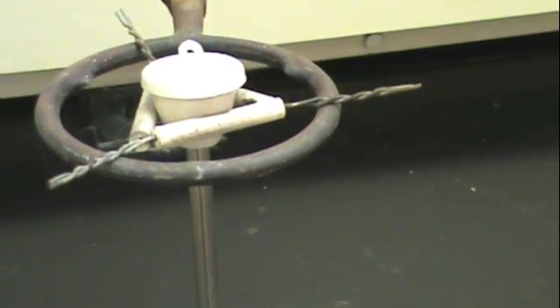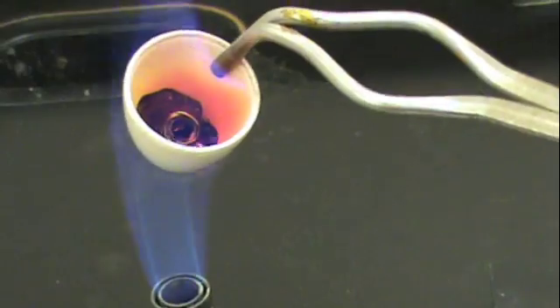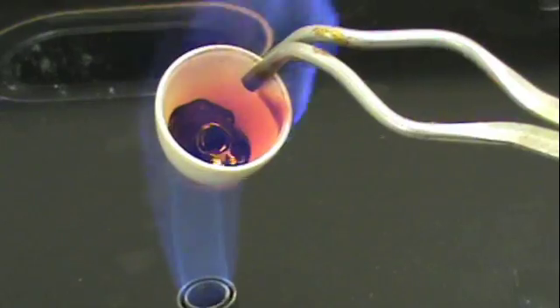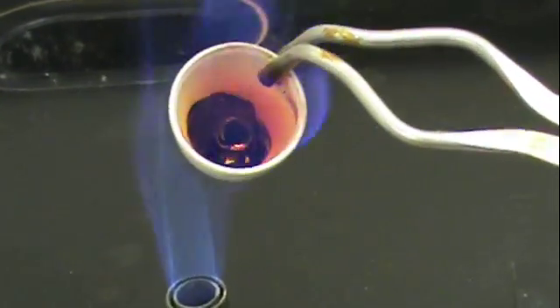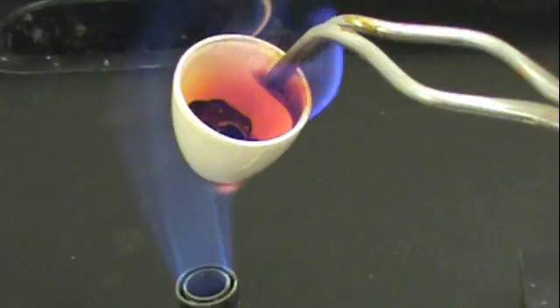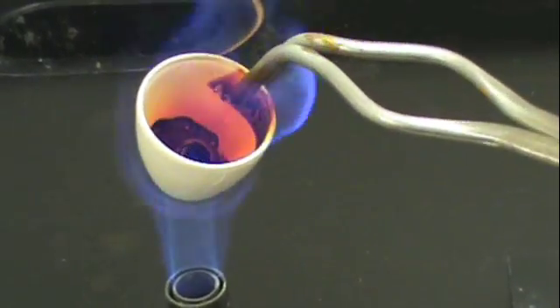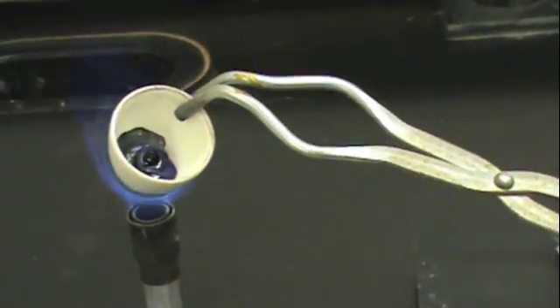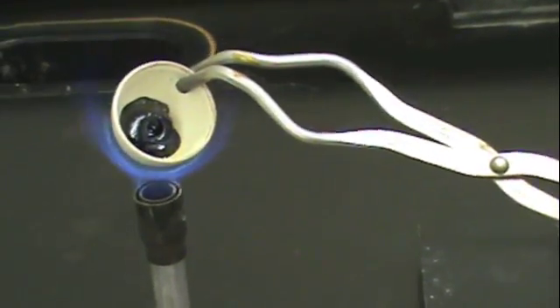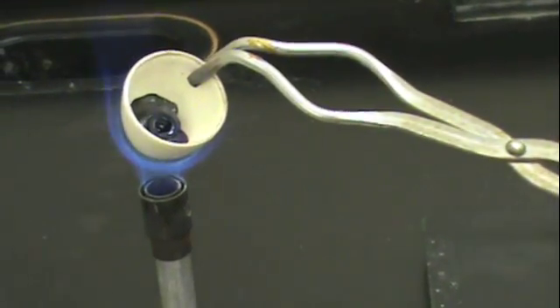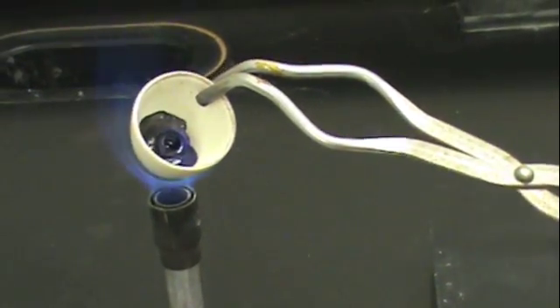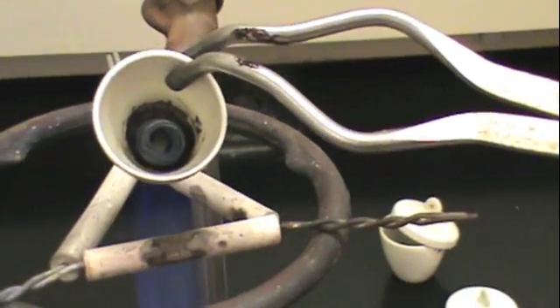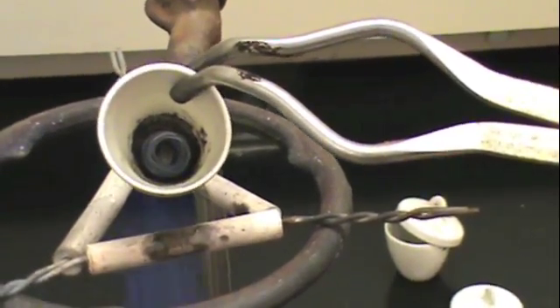After waiting five minutes, there are two methods for removing the excess sulfur. The first is to place the crucible without the lid directly into a bright blue flame and allow the excess sulfur to boil off. You will see this in the form of brown droplets and brown gas coming off of the sulfur. You will continue to heat it until you see that almost all of the sulfur-y tar is gone, and the only thing remaining is a coil which has changed from orange to a grayish color.